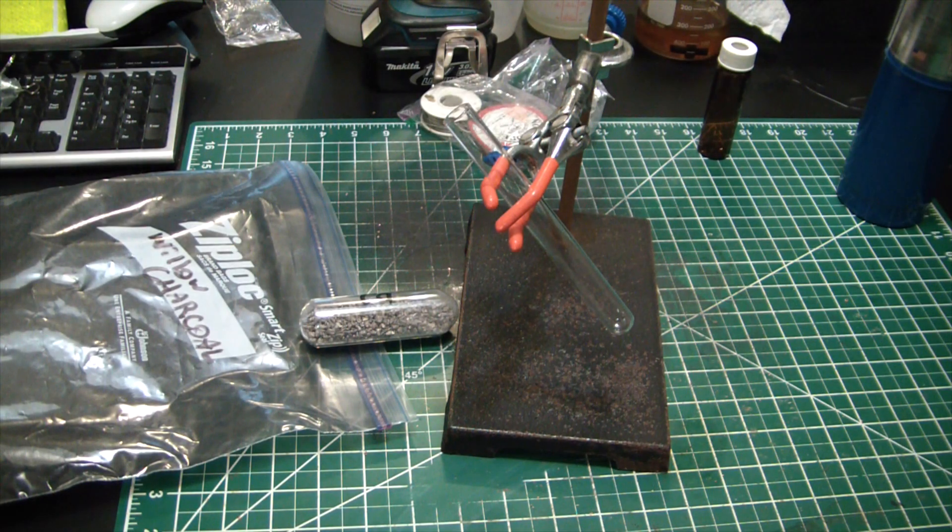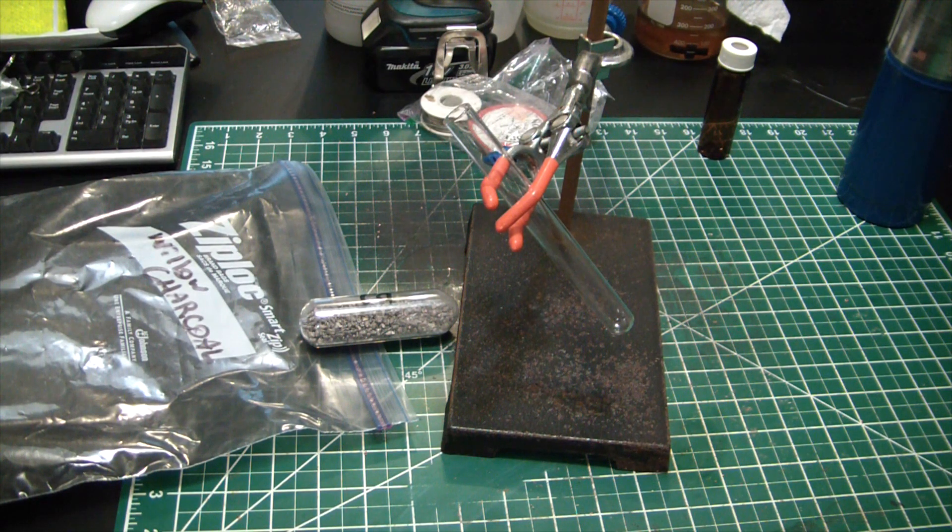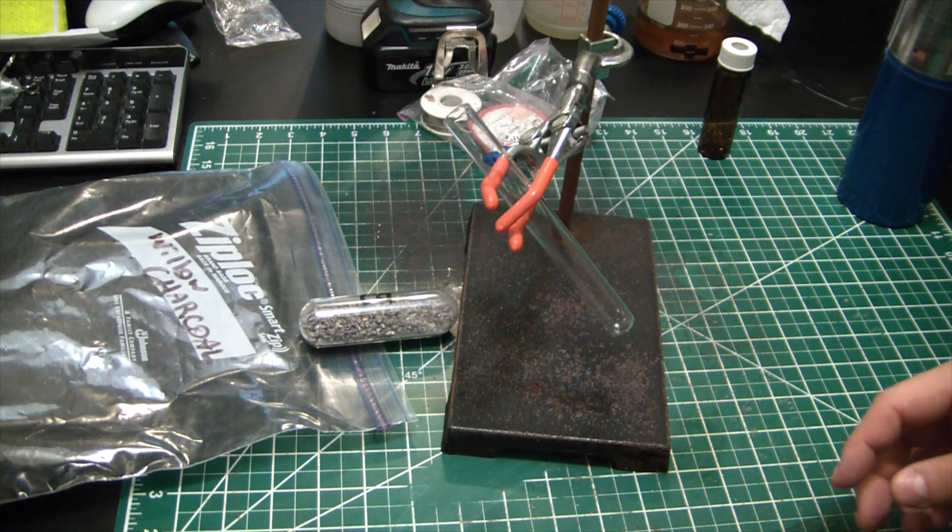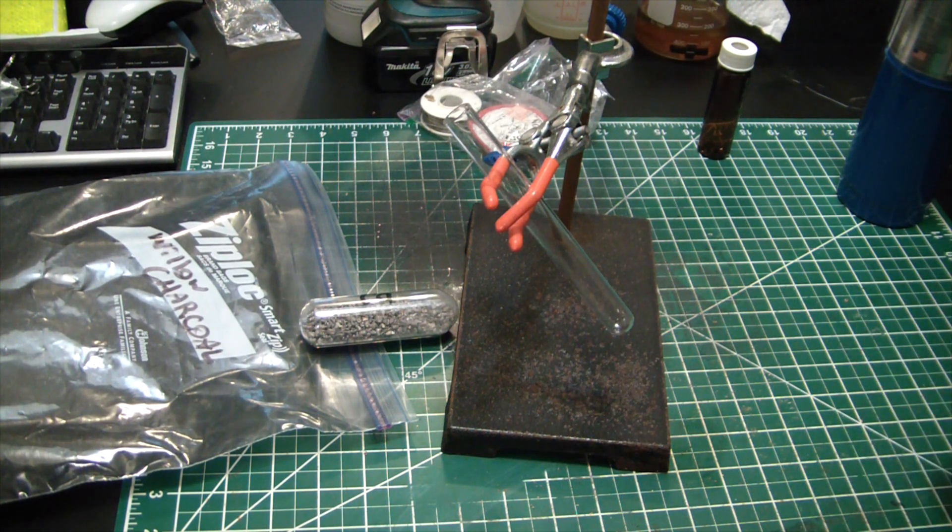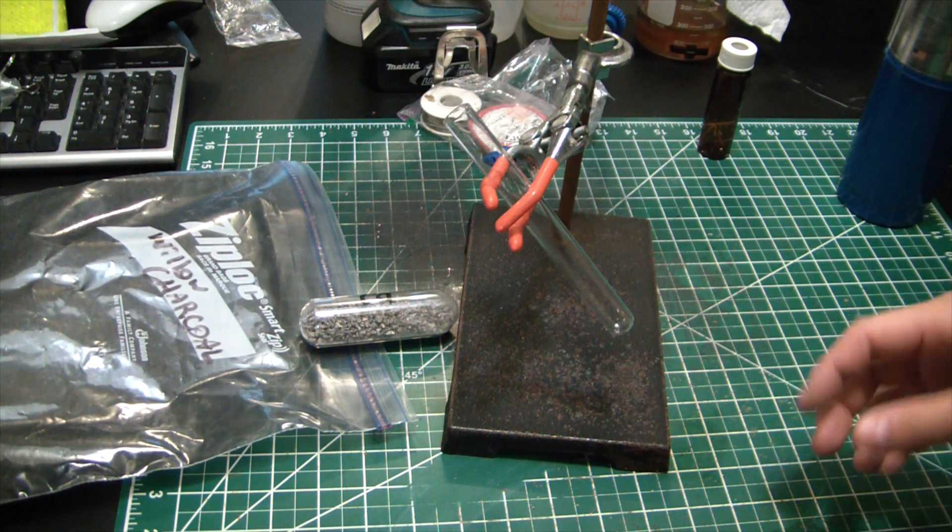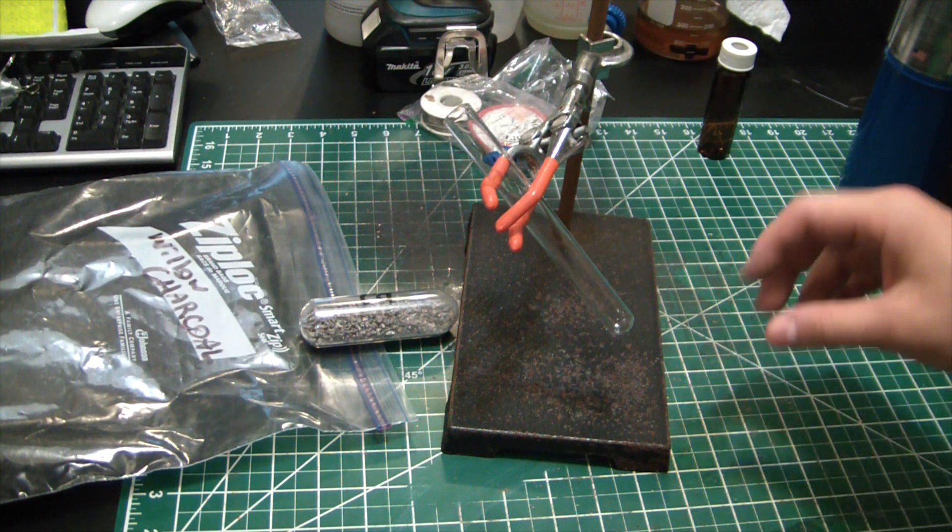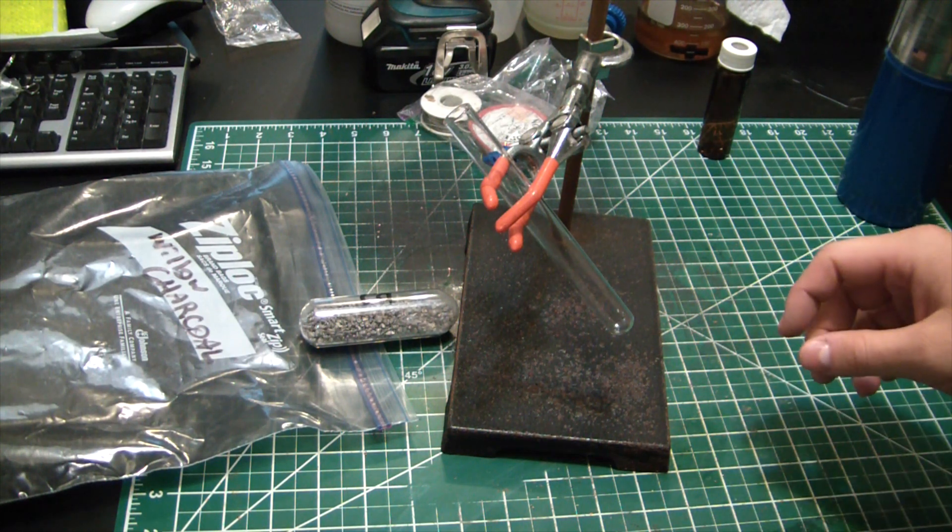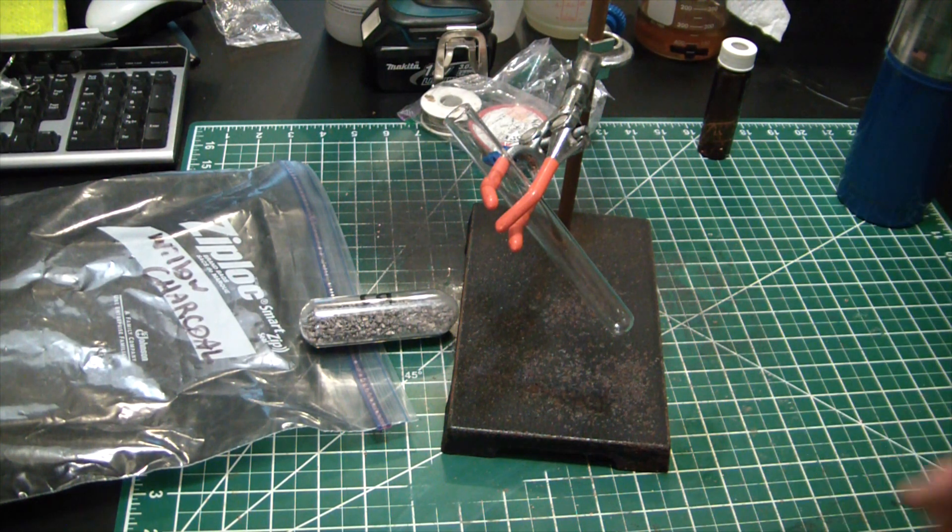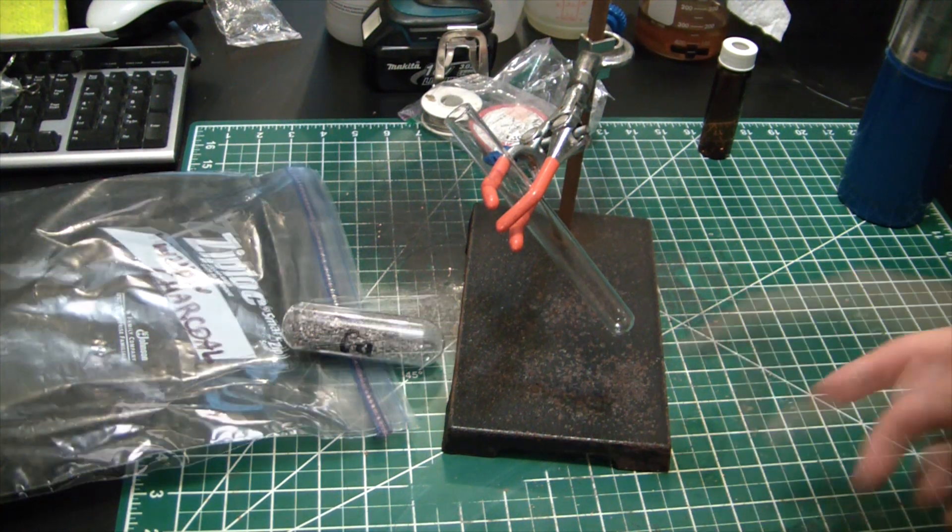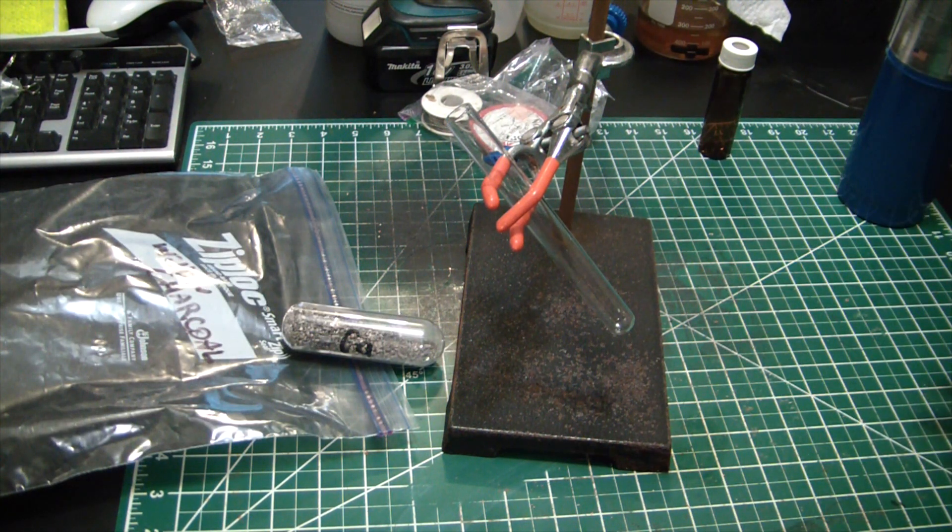Hey, what's going on guys? Welcome back to Elemental Maker. Today we're going to give a shot at making calcium carbide. I've used calcium carbide in several previous videos for carbide lamps, but I wanted to give it a shot making it ourselves. You can buy it commercially made and it's much cheaper than this.